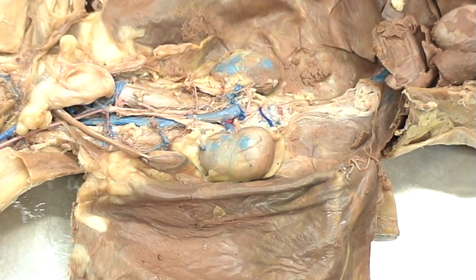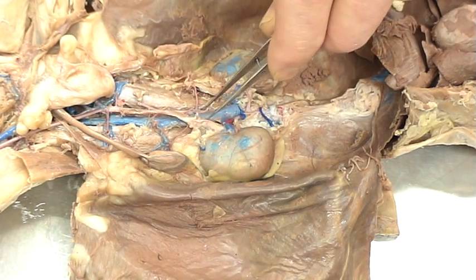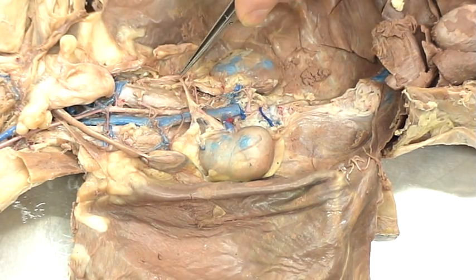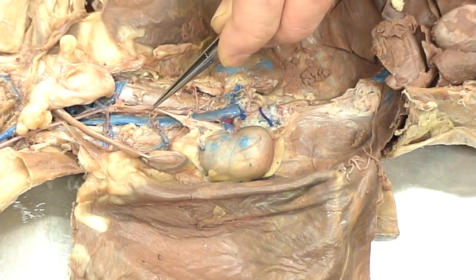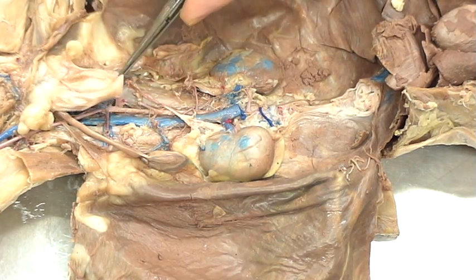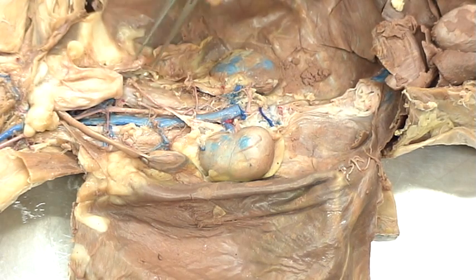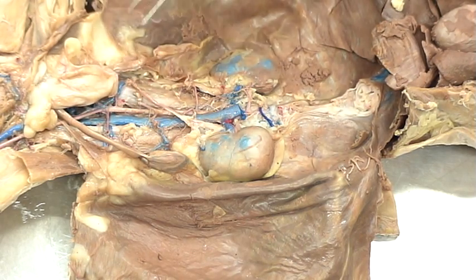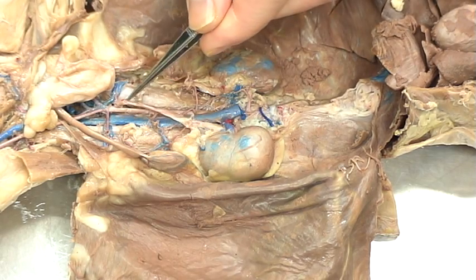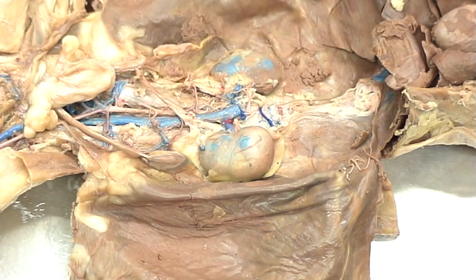What we do see right here is the ureter. It's commonly mistaken for a blood vessel, but what it does is go down to the urinary bladder, which is right here. The urinary bladder is going to be different on different cats because of the state it was in when they were euthanized. The ureter is going to be working its way down this way.